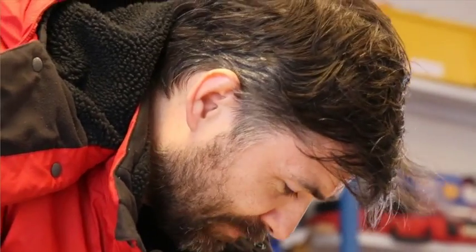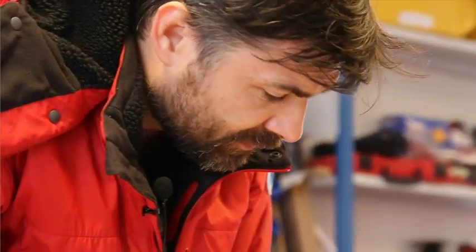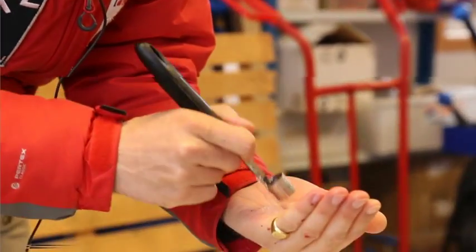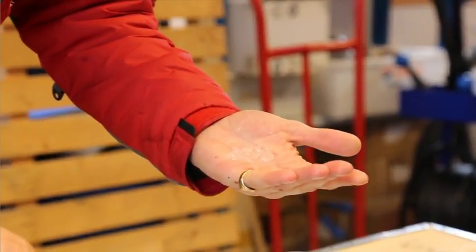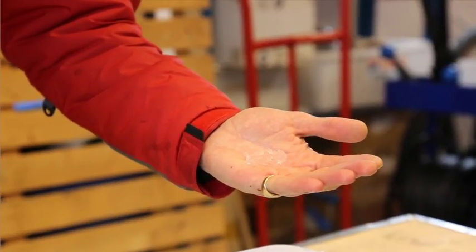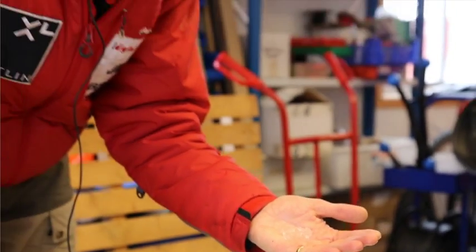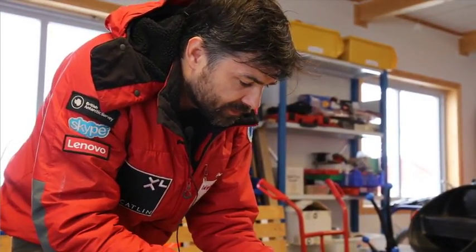This is not what scientists are doing, wiping their hands on their trousers in between samples. Much more careful than that. There's some tiny bits there, I'm just taking note of those. Really, really important to make sure that you're not getting that contamination of samples. You're doing a better job than wiping your hands on your trousers to prevent that. A lot of rinsing's happening, both with seawater on the outside of our nets to wash the samples down into the end, and also using distilled water to rinse the samples inside, so there's no contamination.